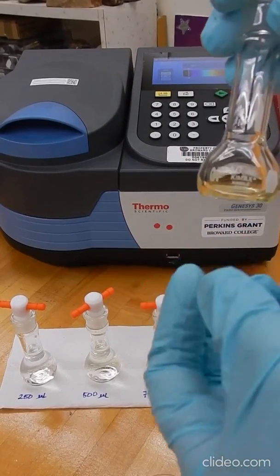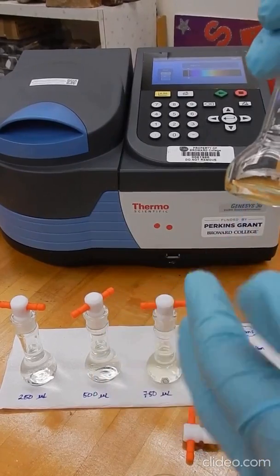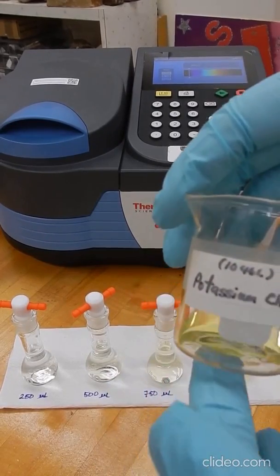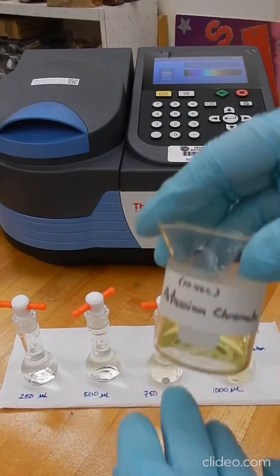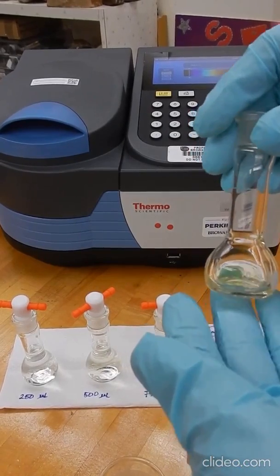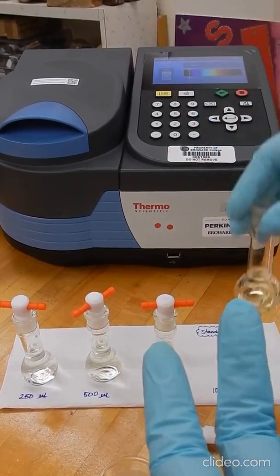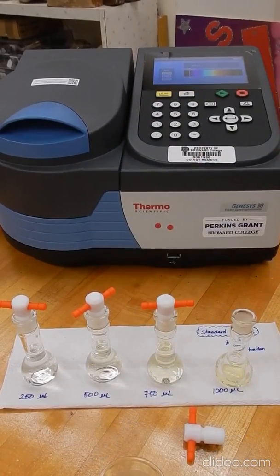To determine the concentration of the standards that I am preparing here, we need the concentration of your solution for potassium chromate. We need the volumes that we're using from our initial solution here, and we also need the final volume. With those 3 numbers, we can calculate the concentration of the final solution, which is the dilution. And we're using the dilution equation to find those concentrations.